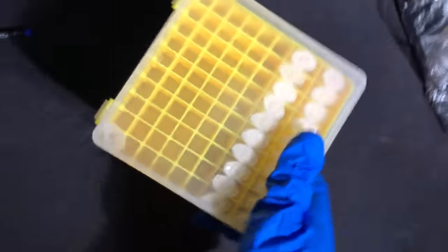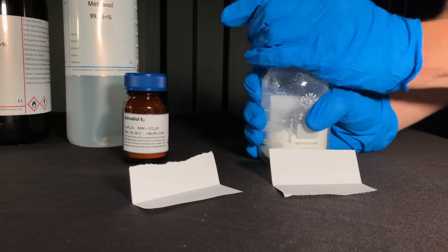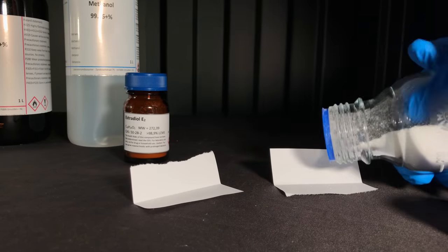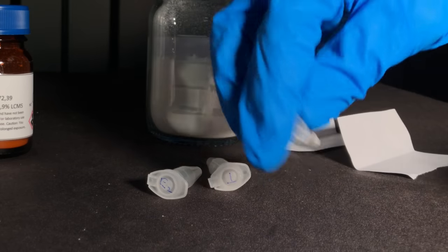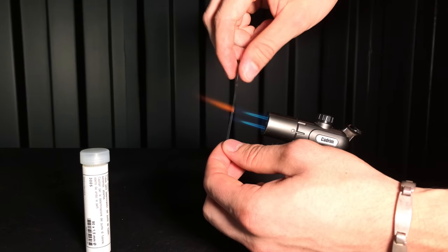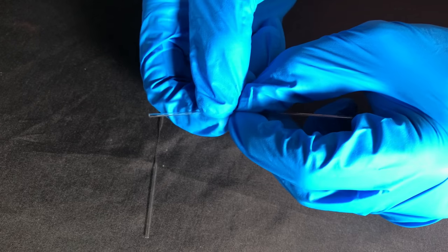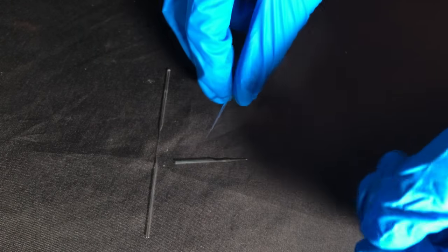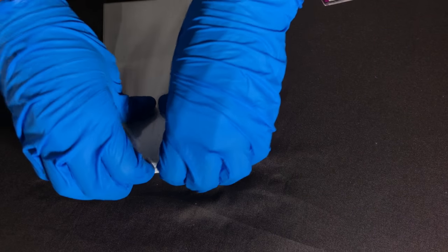And there you have it — a bunch of vials that men shouldn't touch. To find out which vials contain estradiol and where it could be contaminated, we are going to try running a TLC. As a comparison and to test if it would even work, an estradiol solution, a testosterone solution, and a mixed one will be prepared. Estradiol and testosterone are both very soluble in methanol, so that will be our solvent. Close up the vials and aggressively shake them. Putting small spots of solution onto a TLC plate is a challenge if your capillary tubes are thick. A life hack to make it work is to heat them up, stretch them out, and break them in the middle.